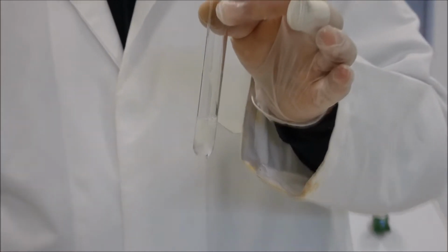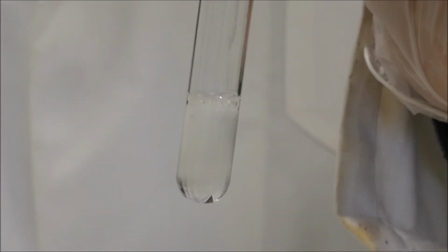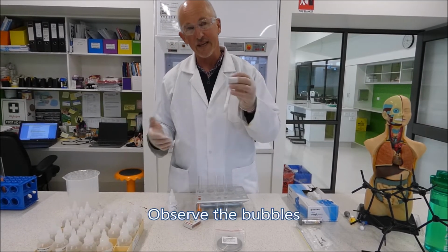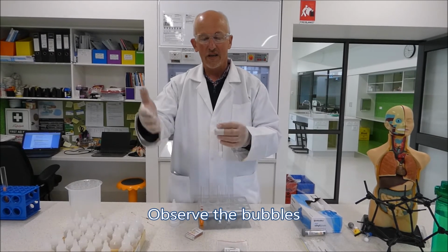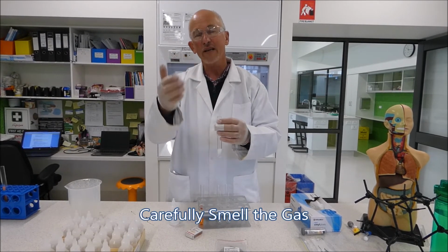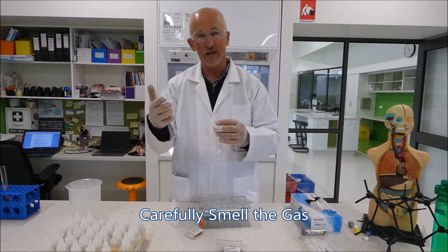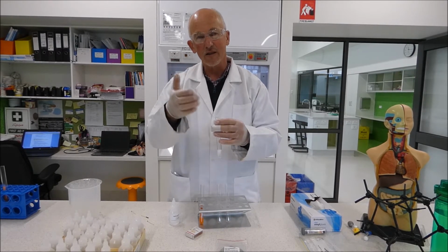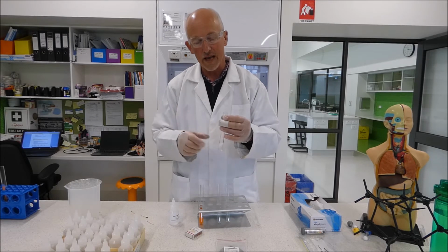Now you might actually be able to see that even there, it's bubbling away madly, which suggests that there's a gas forming. So there's 3 ways you can actually test for the gas. You can look for the bubbles. You can actually waft it towards you. You've got to be very careful. You don't know if the gas is toxic or not. So you've got to be very careful about how you smell gases and see if you can smell something different coming out of the tube. That's another sign of gas being formed.